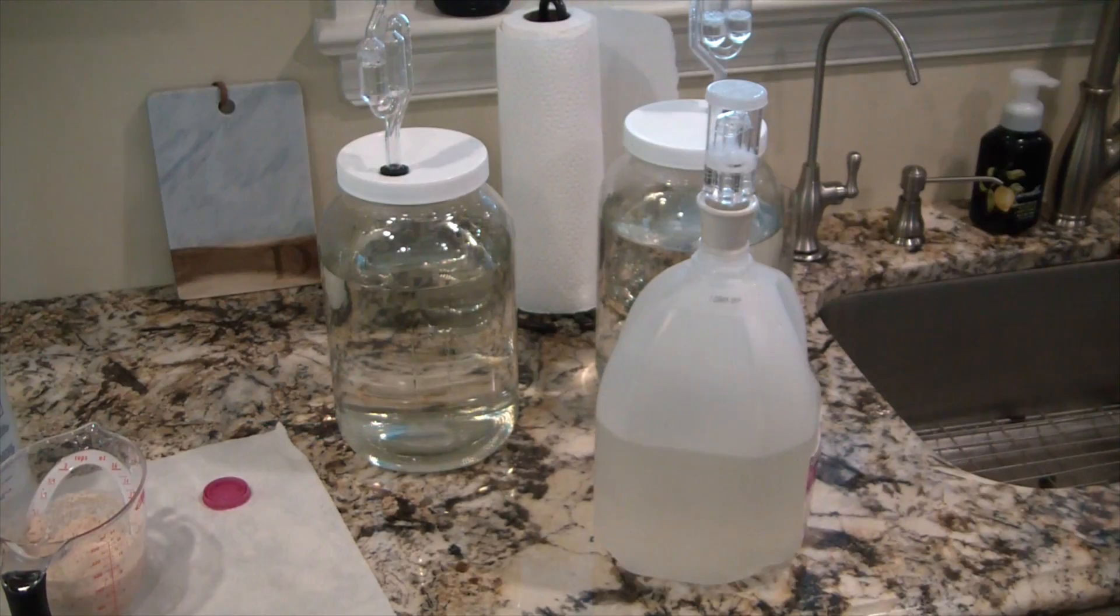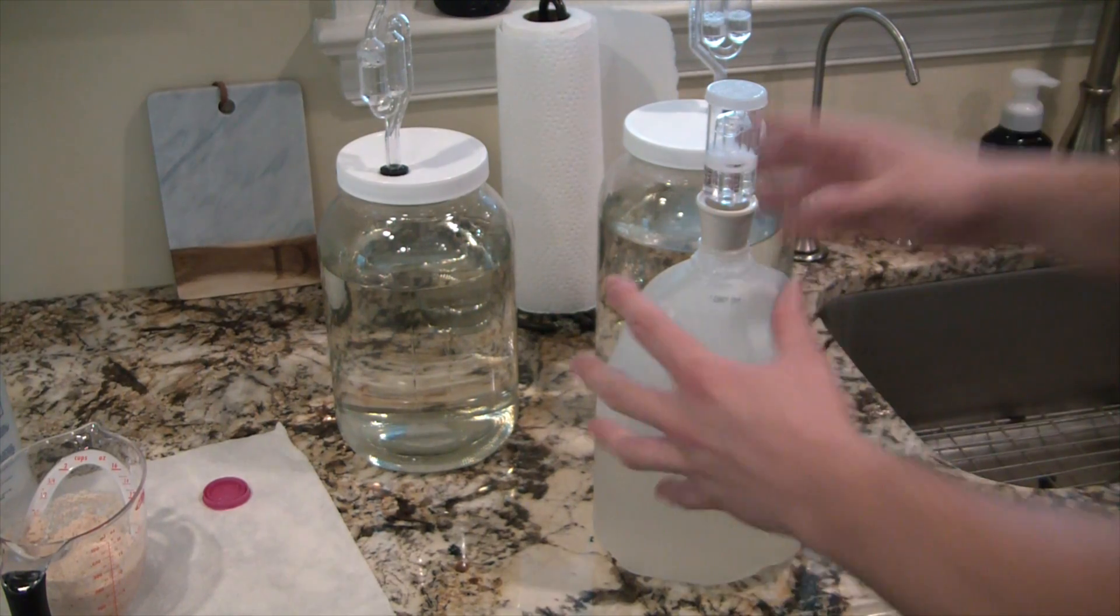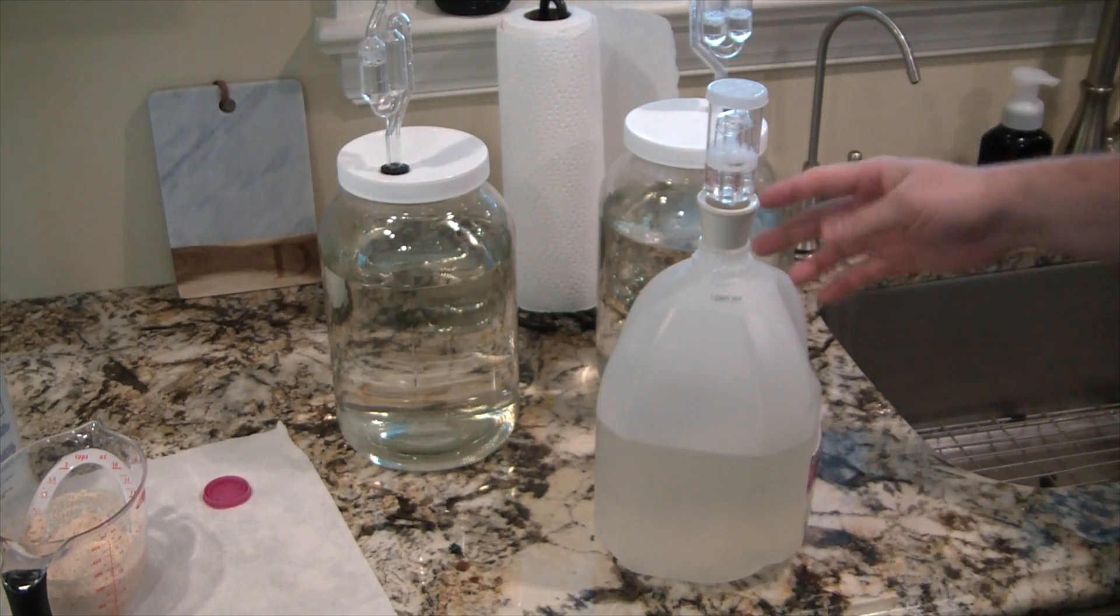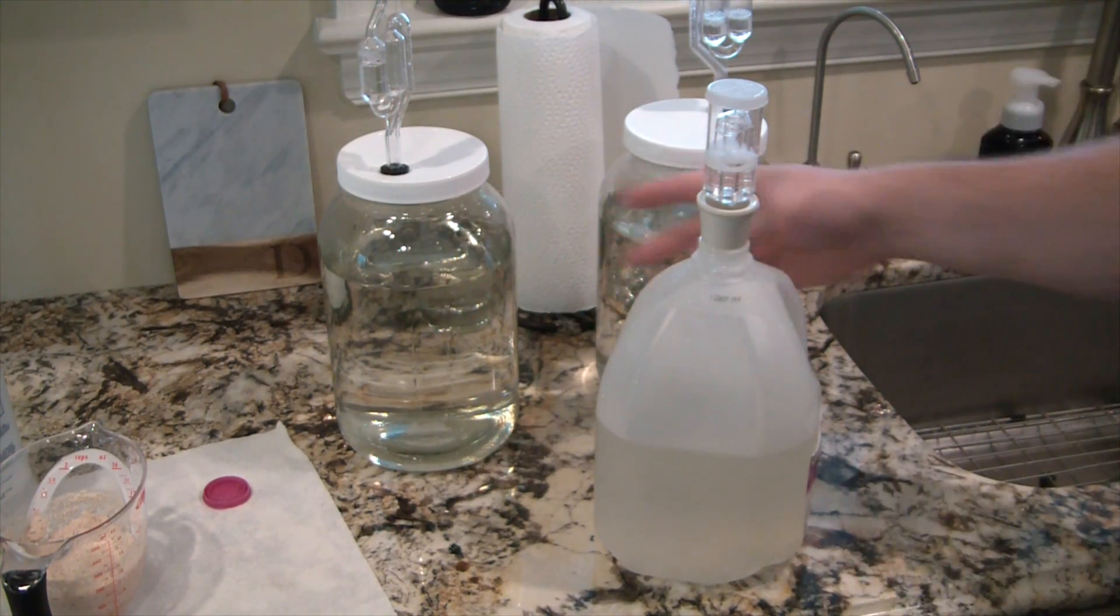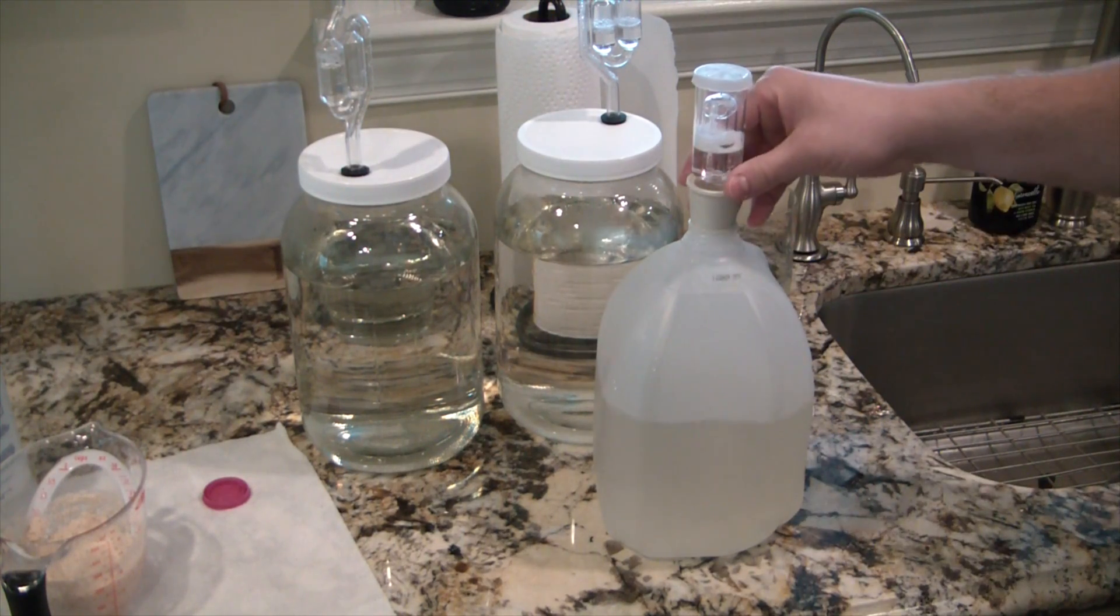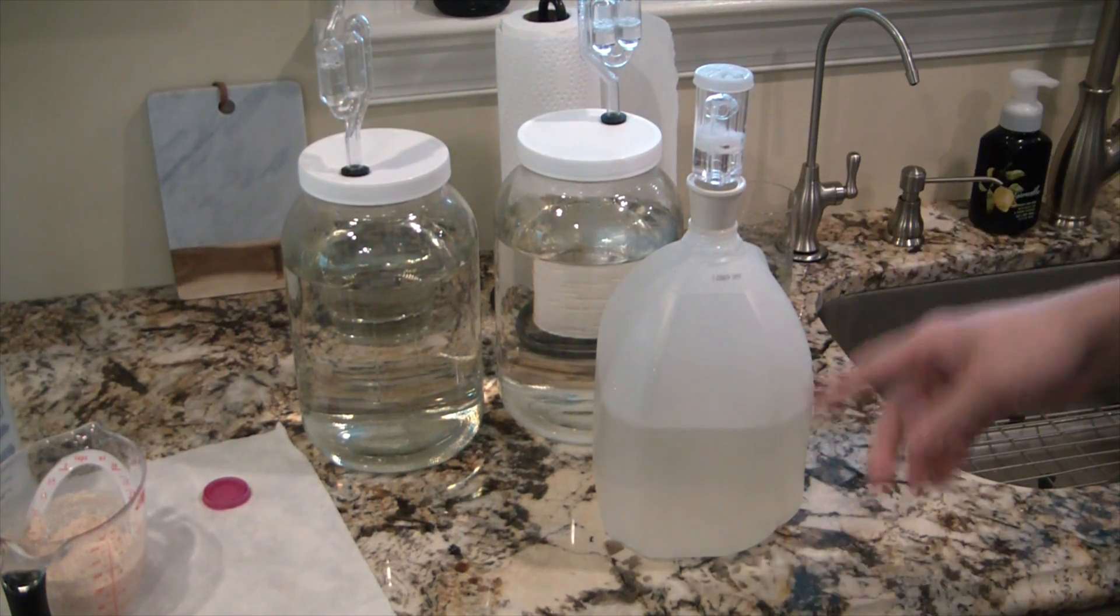So you can see I got a third fermenter set up here. I was not happy with having such a small amount of headspace. I still think this is too short, so got a third fermenter set up here. It's a bit of a redneck rig but it should work.